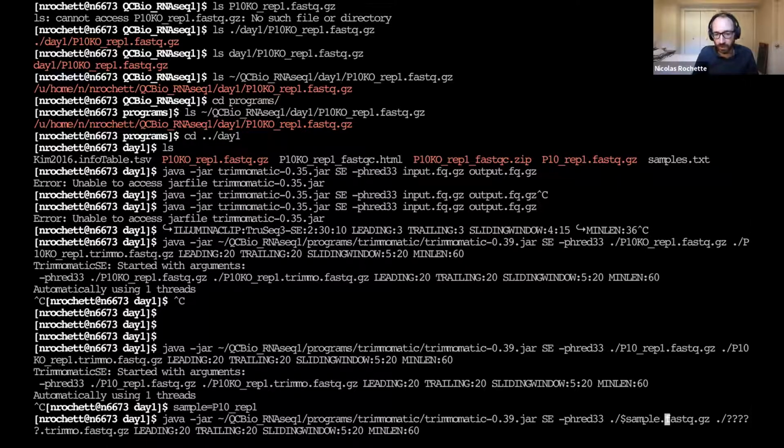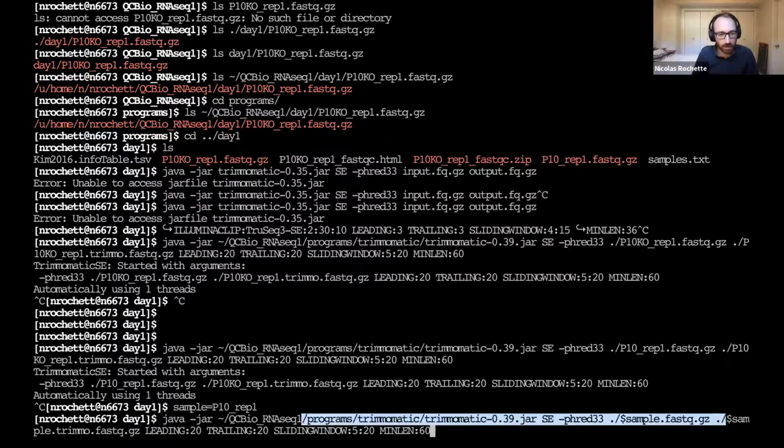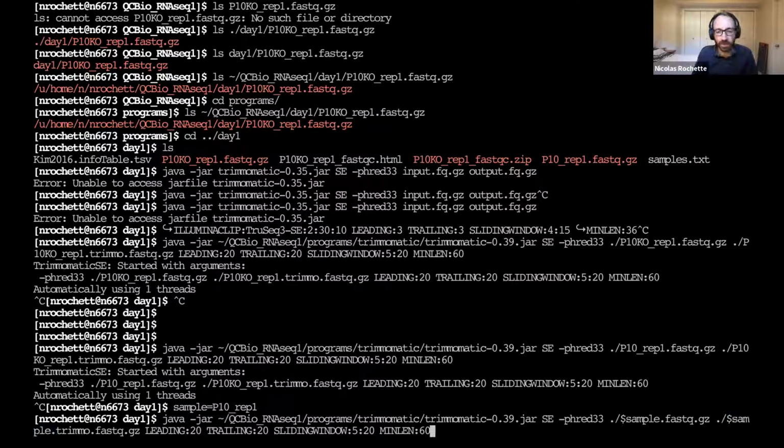And this is how we can use our shell variable with $ and then the name of the variable. Okay, and now we have those two places that have the same sample name.